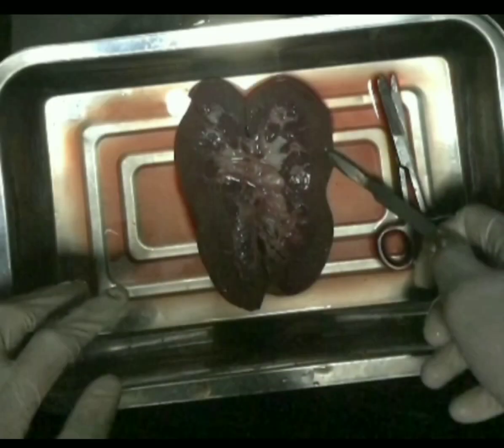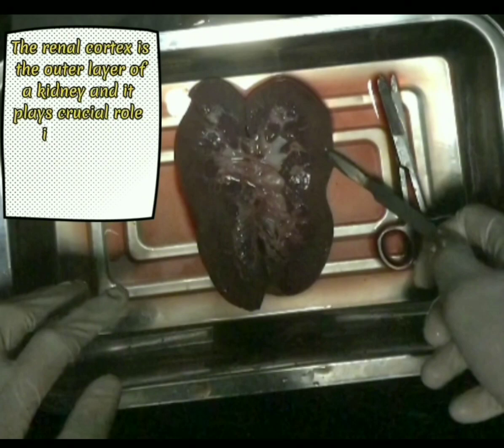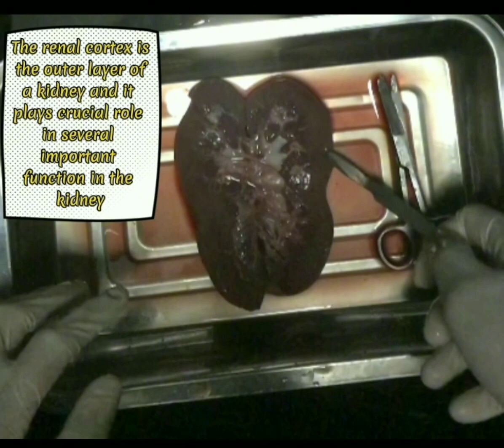Now, what I'm pointing is the renal cortex. The renal cortex is the outer region of the kidney, and it plays a crucial role in several important functions within the kidney. These functions are related to the initial stages of blood filtration and the regulation of various aspects of kidney physiology.